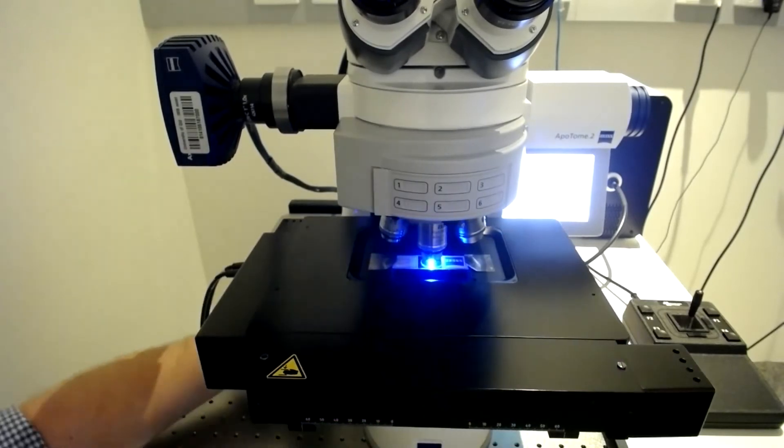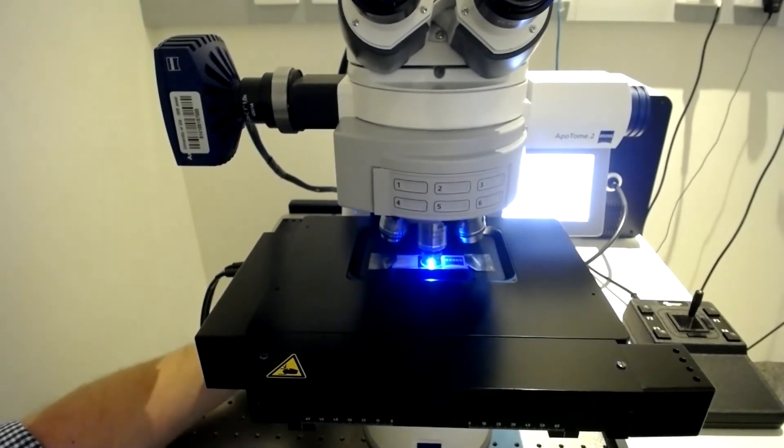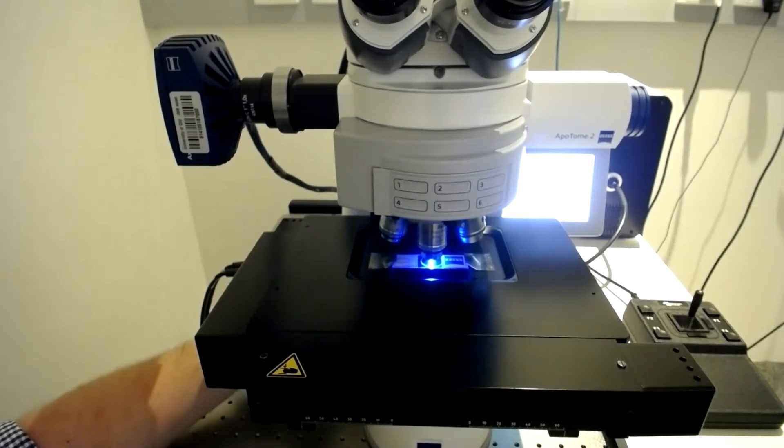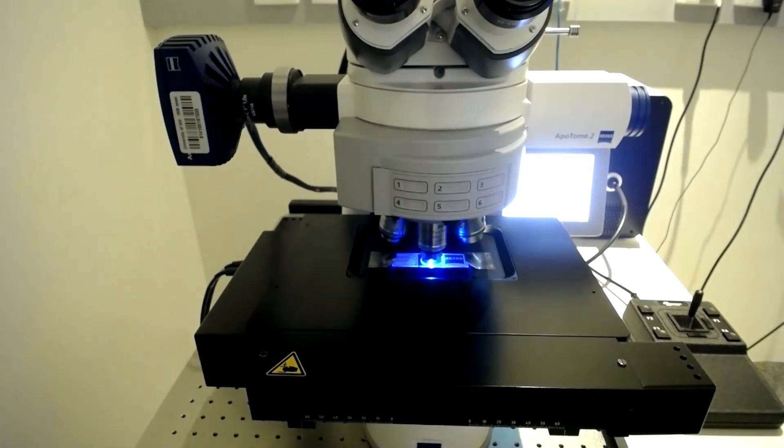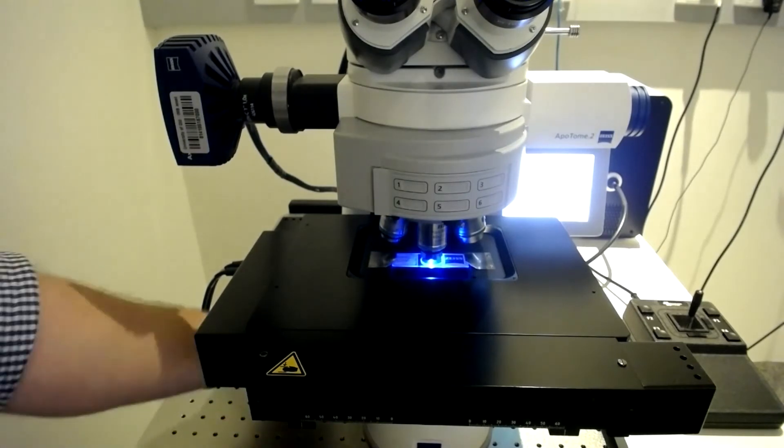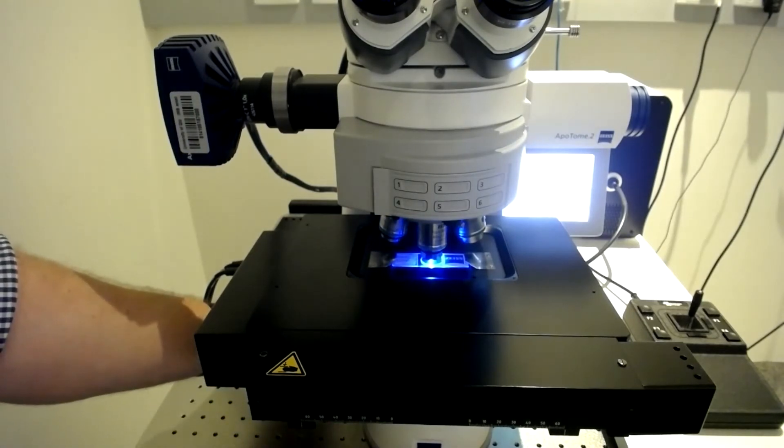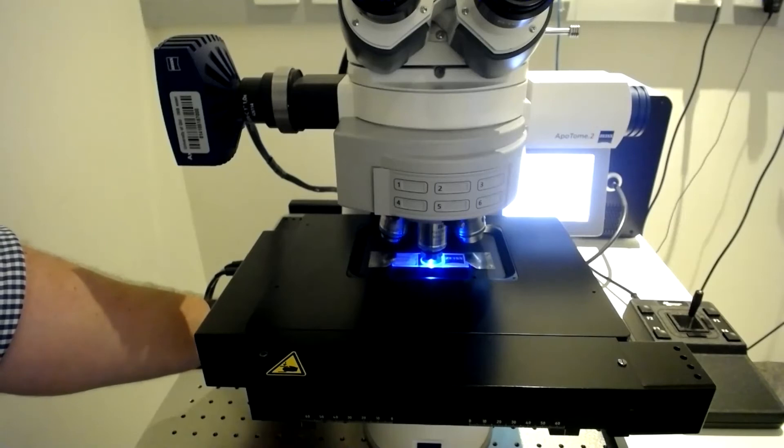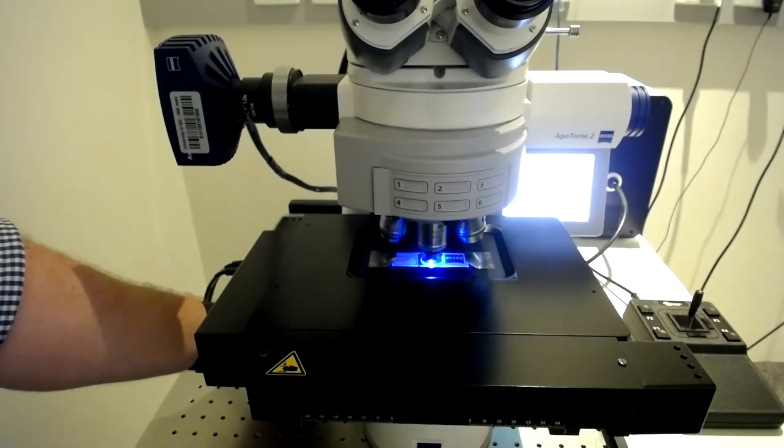I don't need to look down the eyepieces until I know the objective is within the oil. To do this, I'll look for a flash when the objective meets the immersion fluid. I can then use the eyepieces to find the correct focus using the fine adjustment knob. And we have focused our sample.